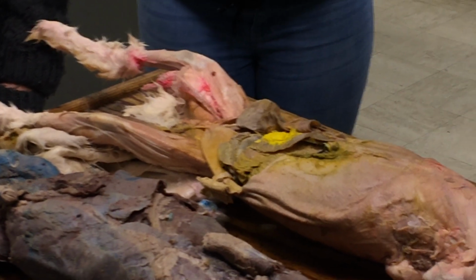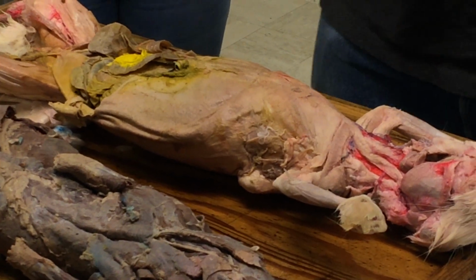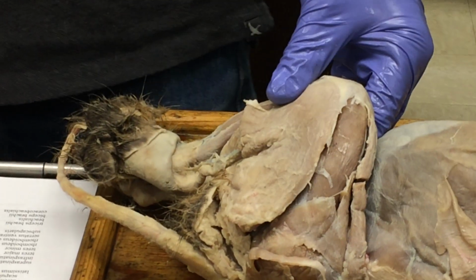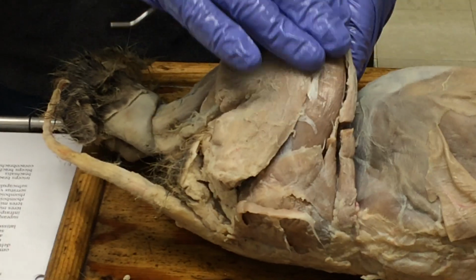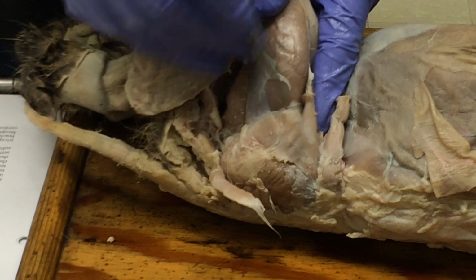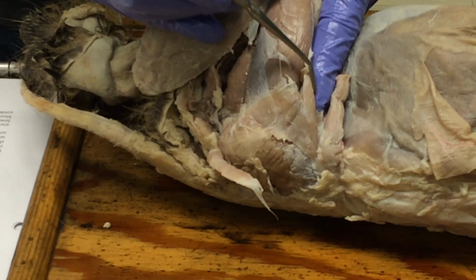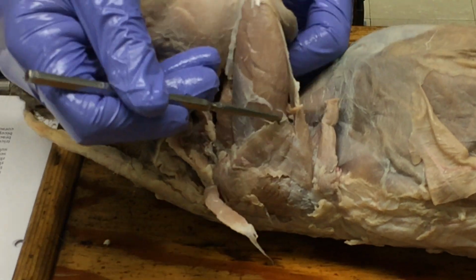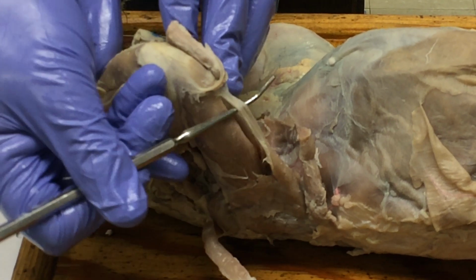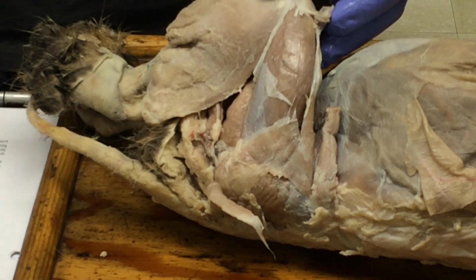Next muscle is the tensor fascia lati, and the fascia lata literally means the broad fascia, so the broad sheet of connective tissue over the side of the thigh. The tensor fascia lati is this muscle here that comes off at the front of the pelvic girdle, comes down like this, and it runs into that fascia. And most of it's been removed, but you can still see some of that fascia here that it's connecting into. Okay, so that's the tensor fascia lati.